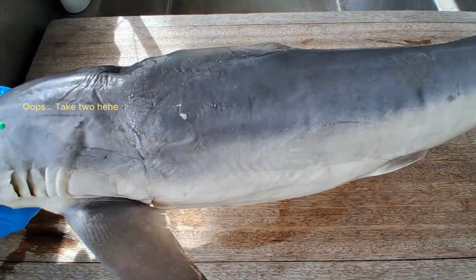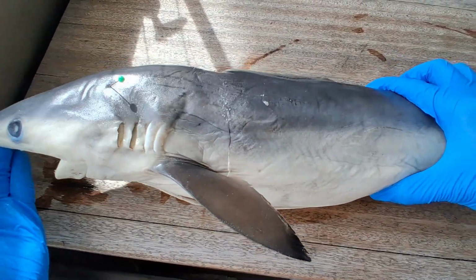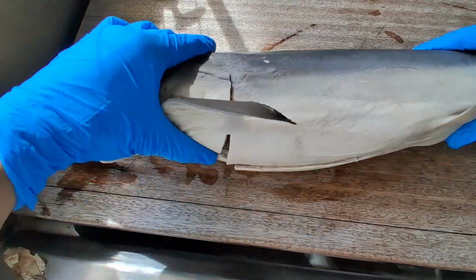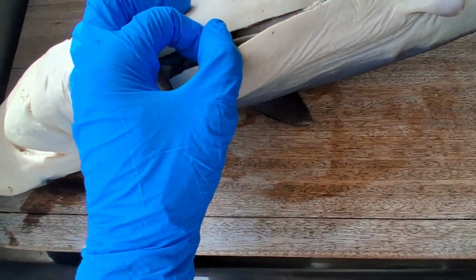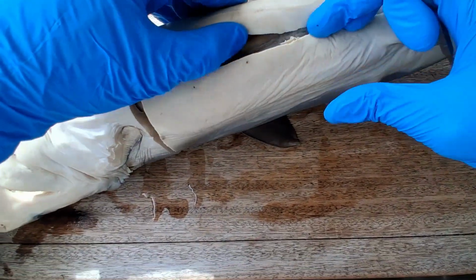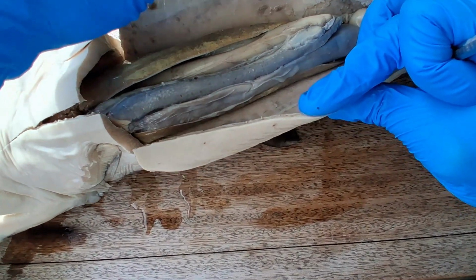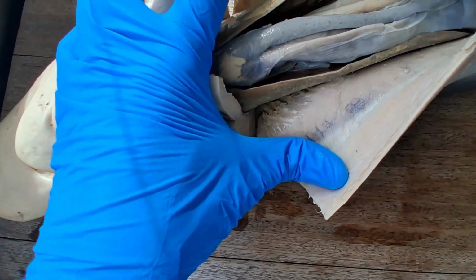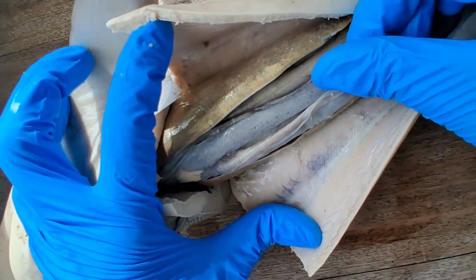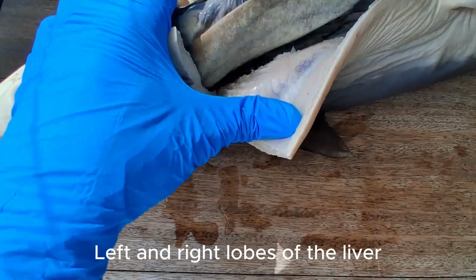So let's take a look at the visceral organs of the shark. This one is from the Rhizoprionodon species. I have already cut open the pleuroperitoneal cavity of the shark, where most of the visceral organs are located. Liver lobes: this is the left liver lobe, and this is the right liver lobe.